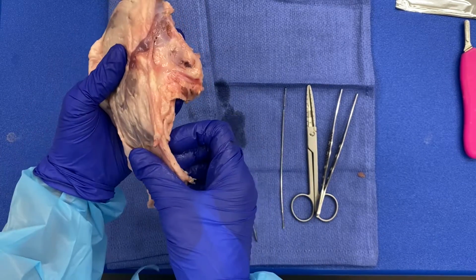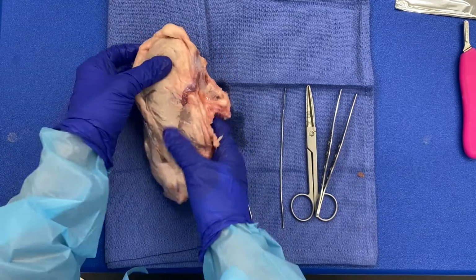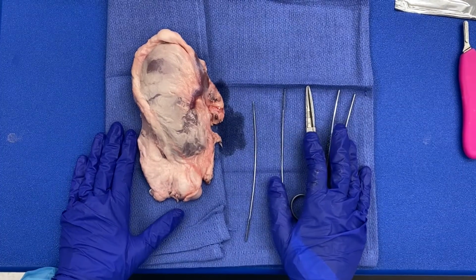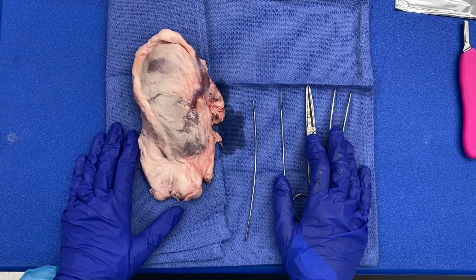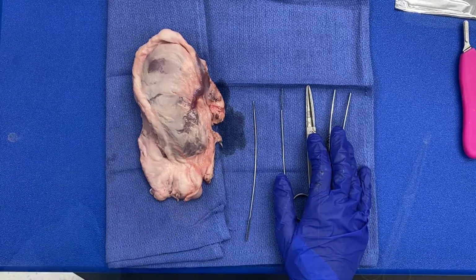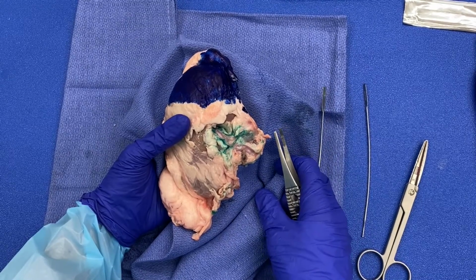All right. So when we receive a kidney specimen, make sure that we weigh the specimen. We measure the entire specimen in 3 dimensions and measure our hilar structures in length and diameter. I am now going to ink my hilar structures. I have now inked several pertinent structures.